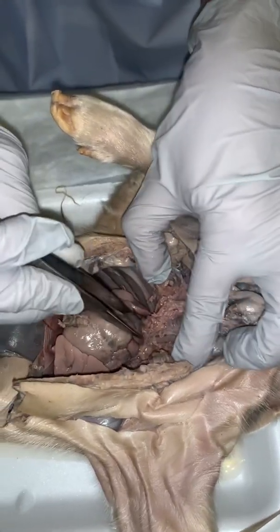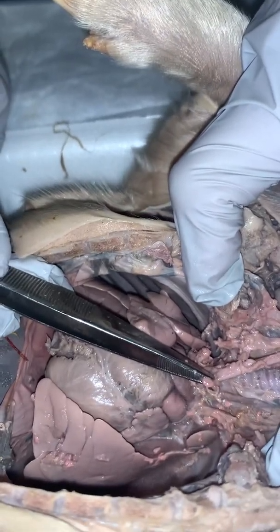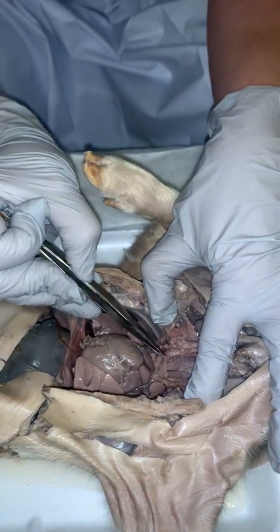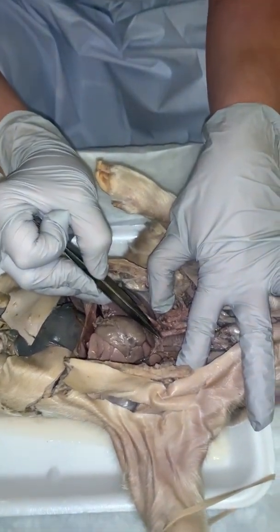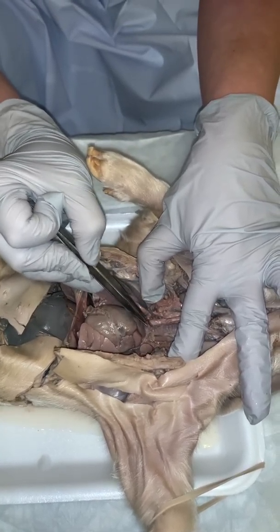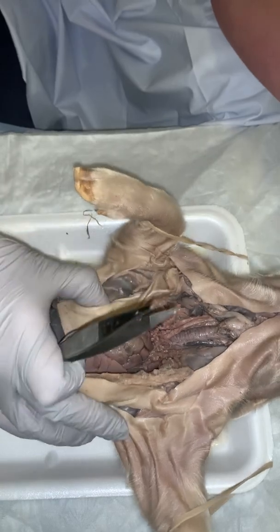Okay, and then again your bronchus and bronchioles. There's that little tube right there. And also, while we're talking about the bronchi and the bronchioles, typically you'll see that objects tend to get stuck more in the right bronchus versus the left. Like a foreign object, it'll get stuck more in the right versus the left. Okay, and that concludes our dissection today of the respiratory tract.